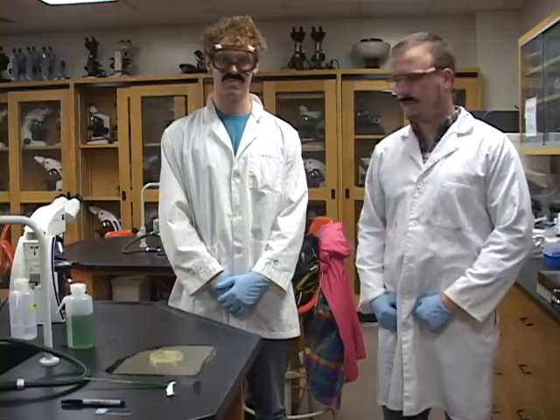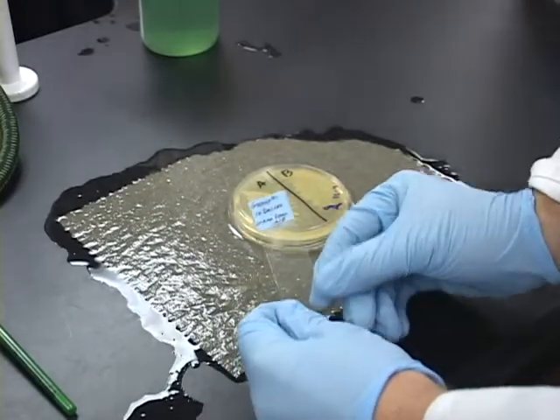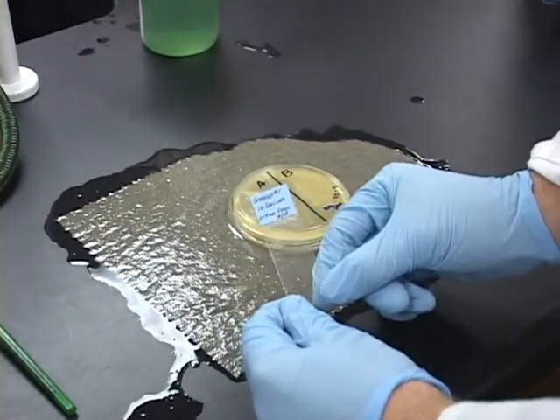My name is Russell, and this is Joe. Joe and I are two members of our group in microbiology, and today we are going to demonstrate the proper way of gram staining. To properly gram stain, you must first identify your slide. As you can see, we have identified our slide as group number 1.